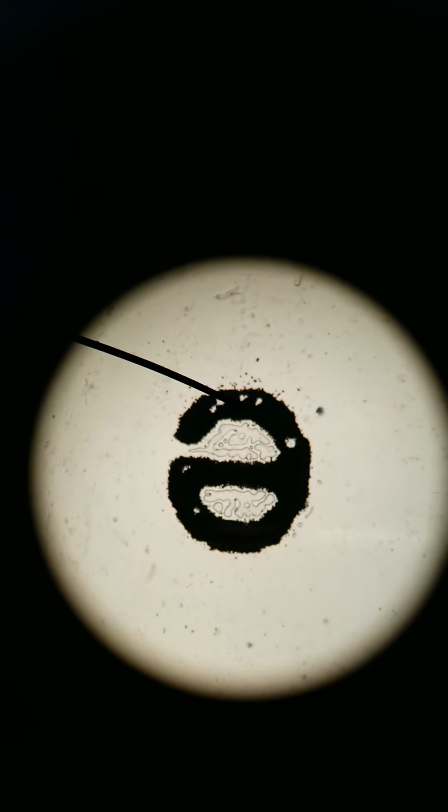To start, since I'm at scanning, I can use the coarse focus knob to bring the stage closer to the lens. So that's what I'm going to do now. Using the coarse focus knob, we can start to see something appear in the center. I've already centered the slide on our stage. Go a little bit closer, closer, closer, and there it is. Now that I've used coarse focus, I'll use fine focus to get it in really good detail. Went too far here, going to go back a little bit, and there we go.